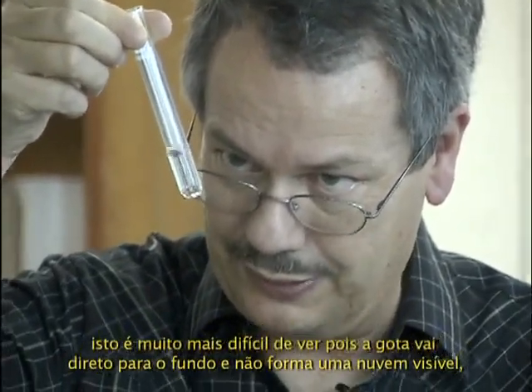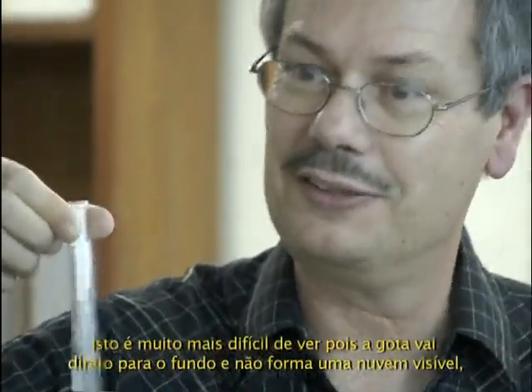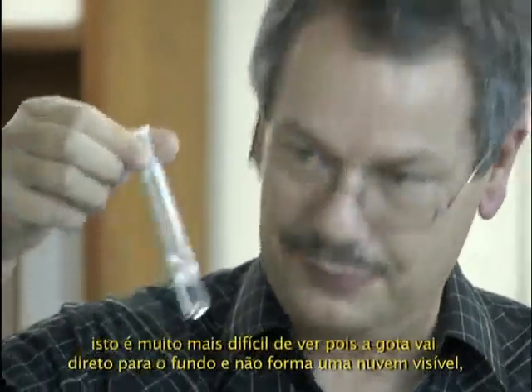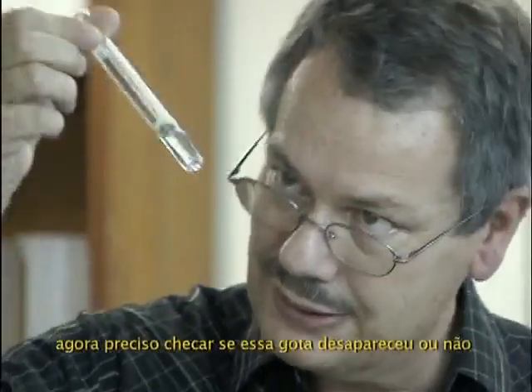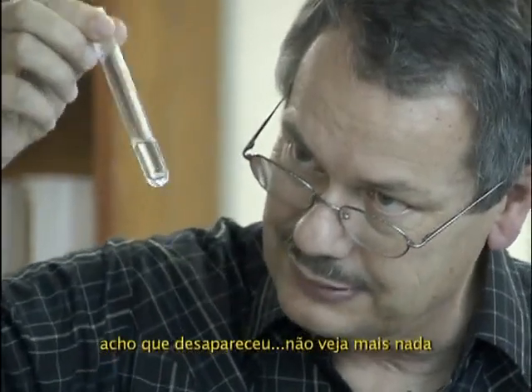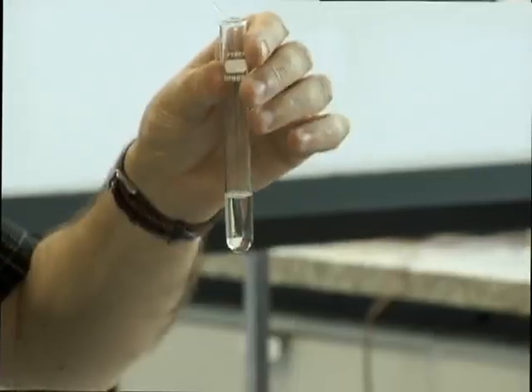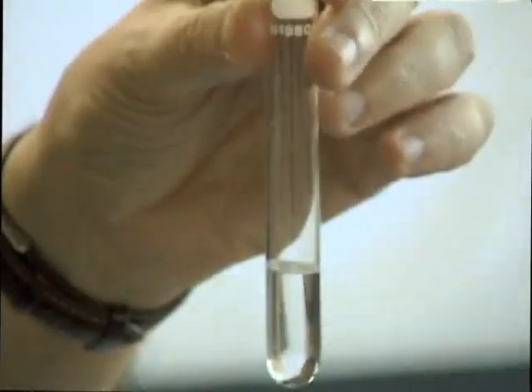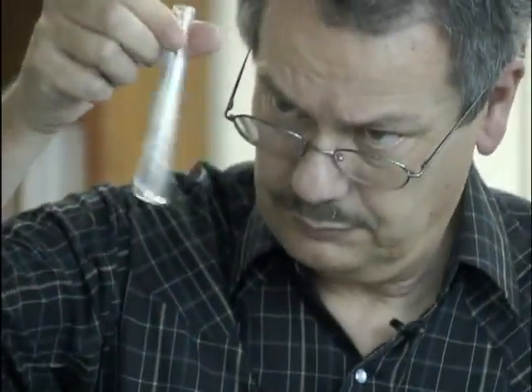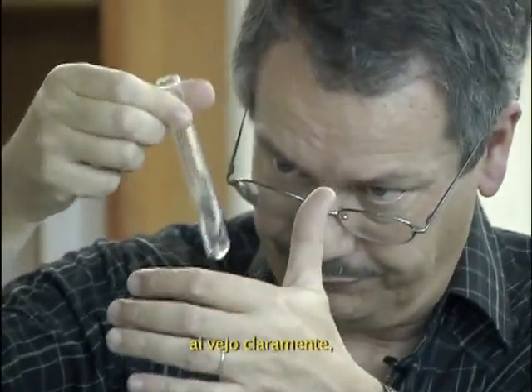This is much more difficult to see because the drop goes to the bottom directly, not making a clear cloud, and now you have to check if this drop disappeared or not. I think it disappeared. I don't see anything more. So I go for a second drop. Yeah. There I see it clearly.